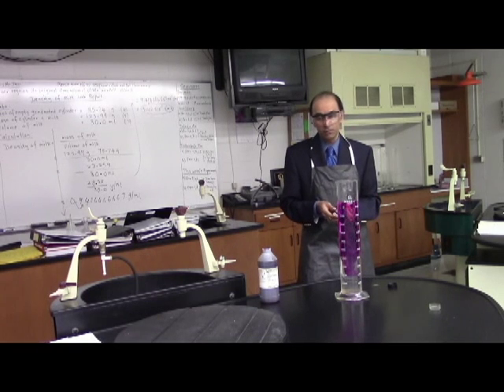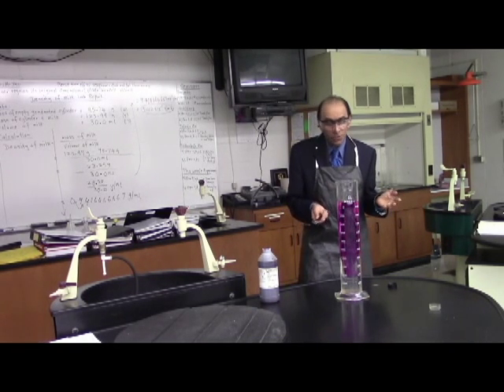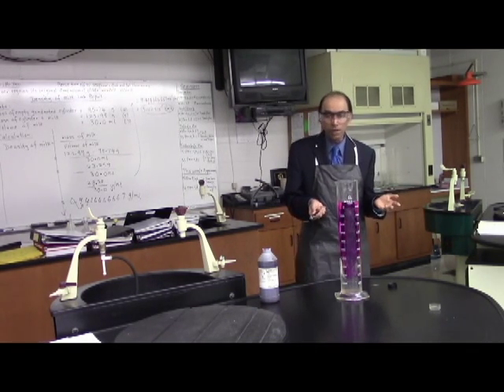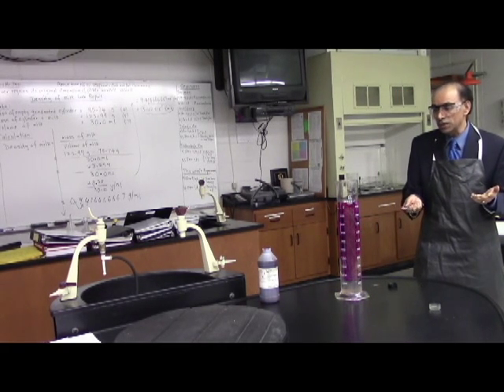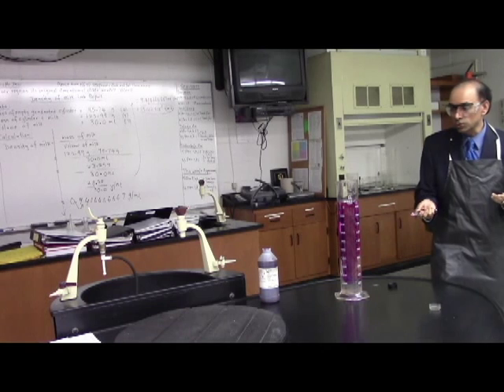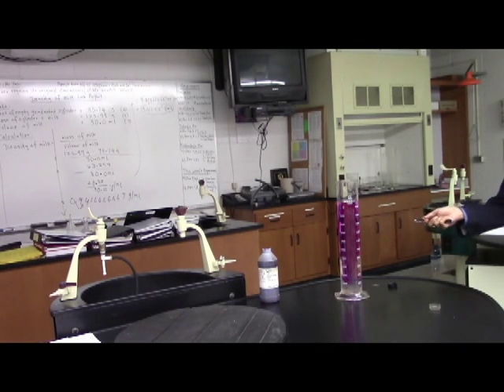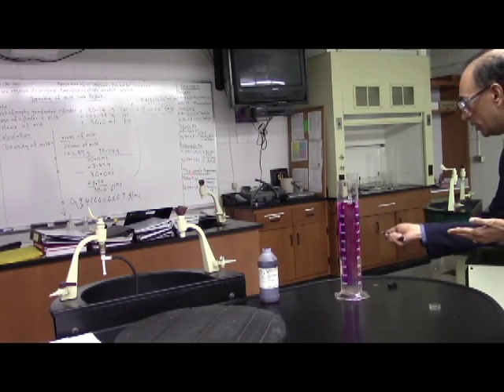Now when it's evenly mixed and you shine a light through it and I have a laser beam here, the light is supposed to go right through. You may not be able to see it on the video but the light goes right through and it actually shows up on the board.